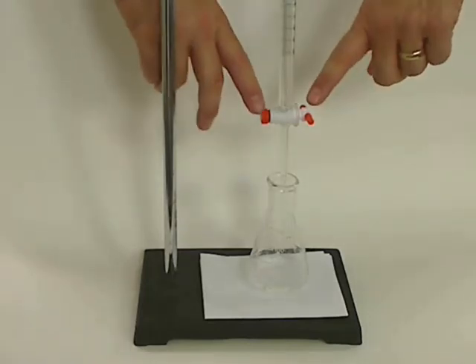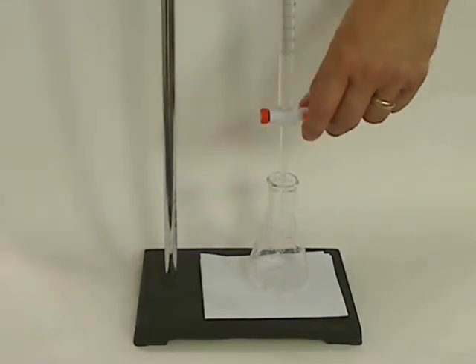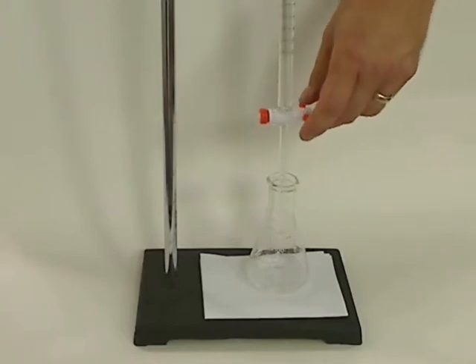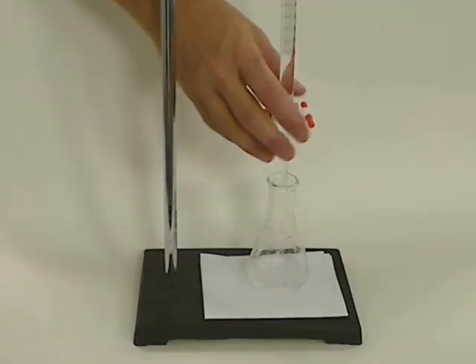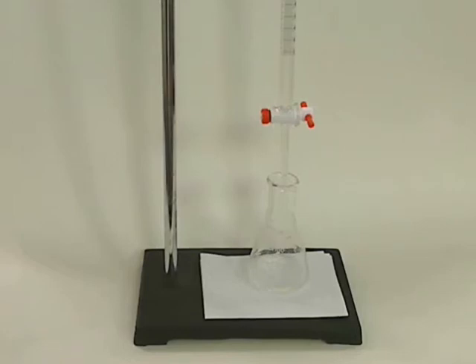With the new Teflon ones, if you have one of these, it's very securely put on here and it's a little bit easier to do it either way. Talk to your teacher and ask what their preferred method is.